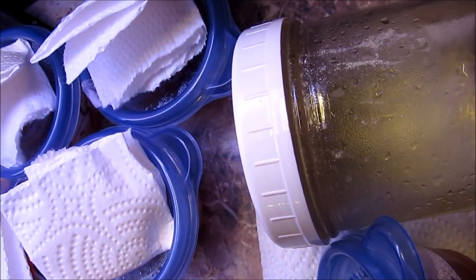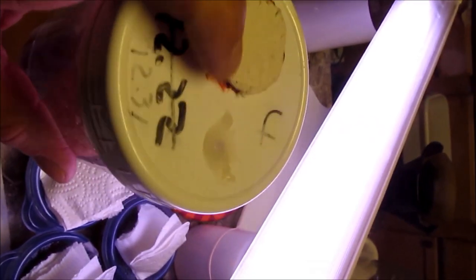I'm going to give you another real quick look at the pasty plate jars here. This is a half-pint jar, basically a larger version of what we're doing. You have the layer of nutrient-rich material or media down here in the bottom. Then on the top you've got a way for fresh air to get in and gases to get out, and a way to inject liquid cultures down into there so you can grow a nice culture on the top of this. It's nice and flat so you can inspect it, make sure there's no contaminants. Shoot a bunch of water through there, shake it up a little bit with mycelium water, suck it back out with the same syringe without even having to take it out, and you're ready to inoculate your grain spawn or whatever else you want to do.